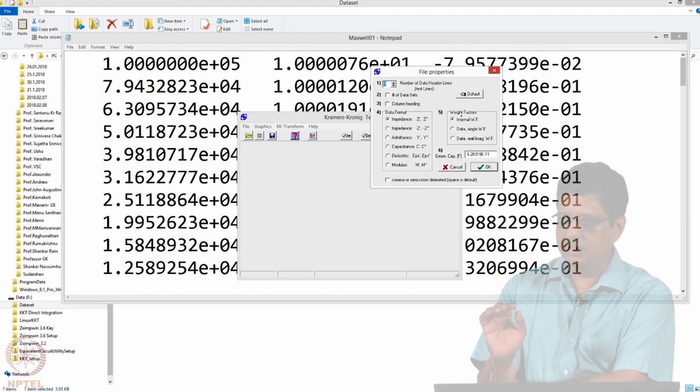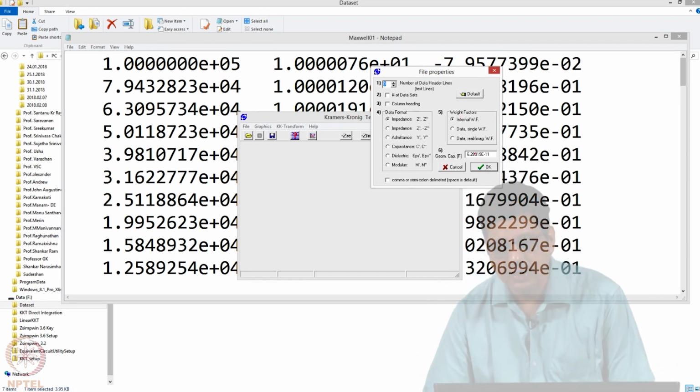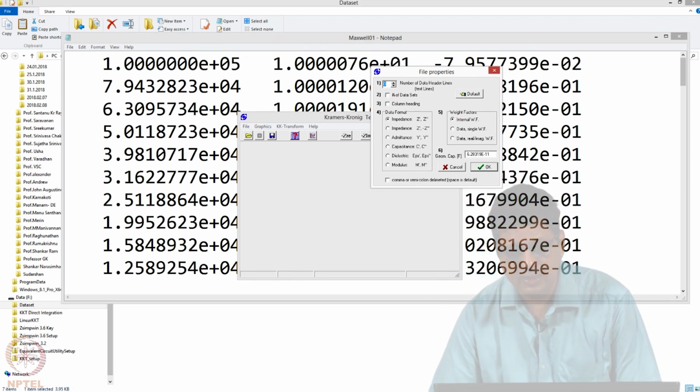Normally, we leave it as internal weight factor which is by default 1, but if you have a better idea of which data has more confidence and which data you have less confidence, you can give that also. This is not relevant, we leave it as it is. If this number of headers is more in your actual data, you will have to give that value, okay.